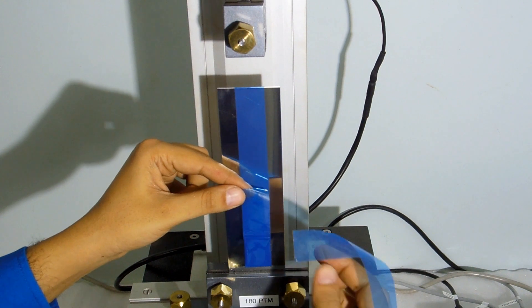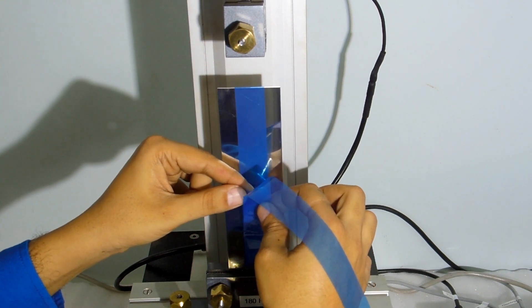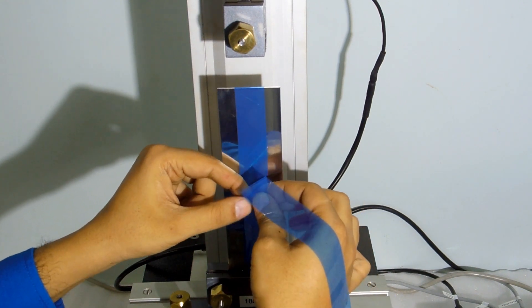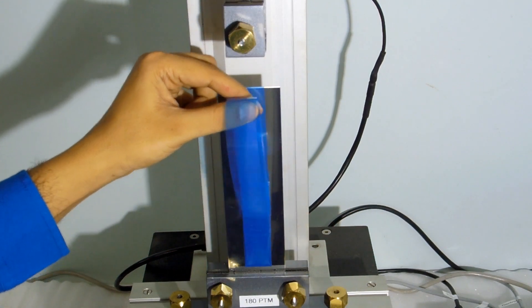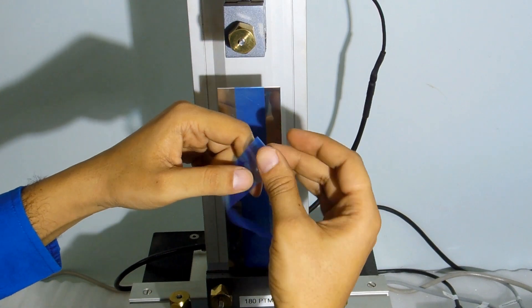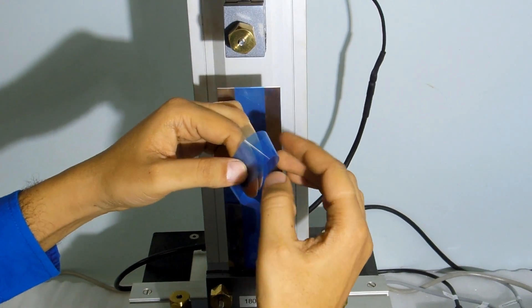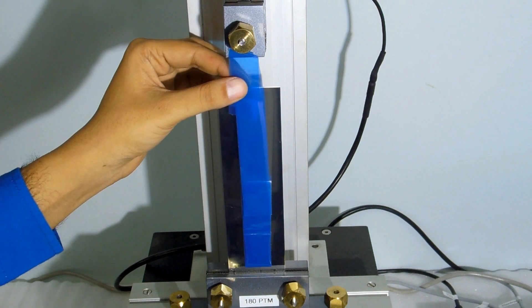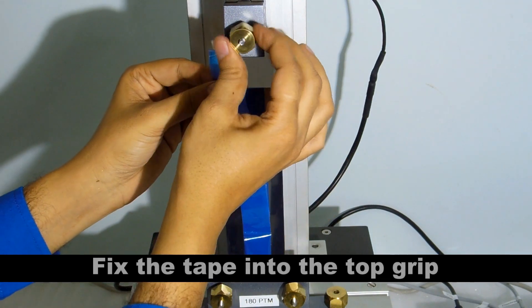Extend the sample such that it can now reach the top grip. Fix the tape into the top grip.